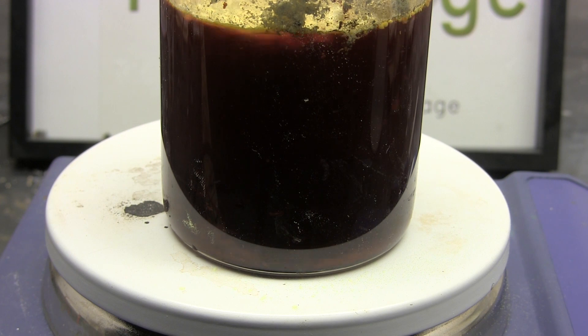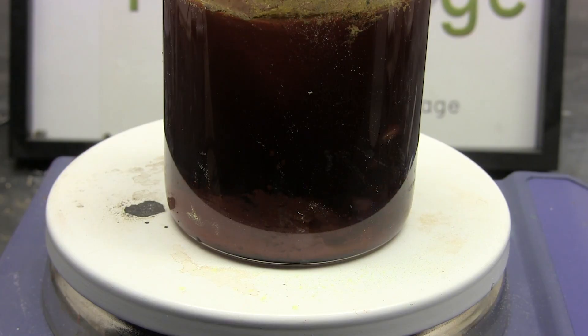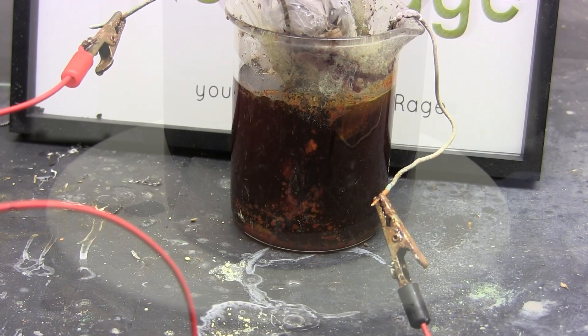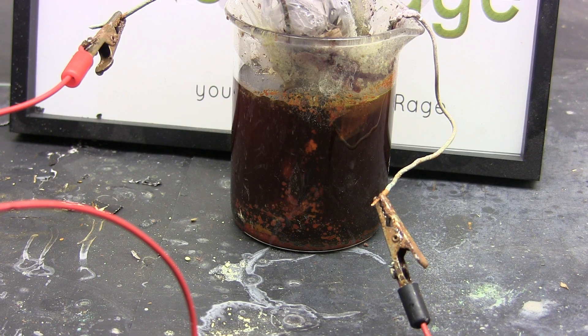The mixture of disulfur dibromide and polysulfides forms a dense liquid that sinks as you can see here. When all of the floating sulfur has been captured put the electrodes back in and continue electrolysis. You may need to top off the cell with water periodically as it evaporates.